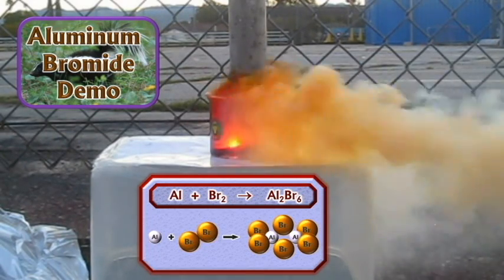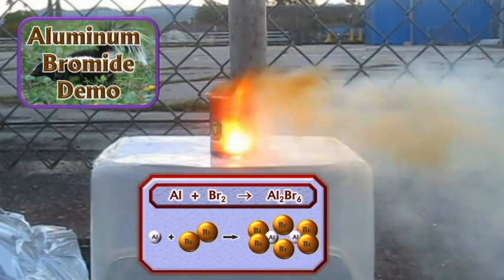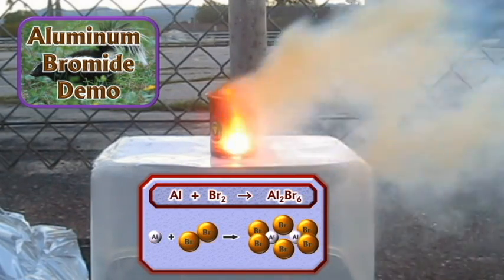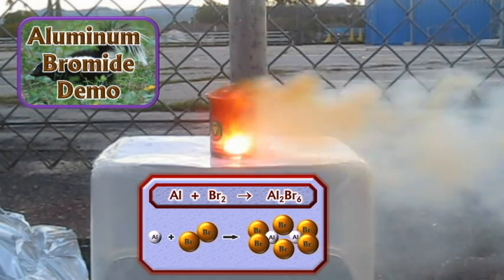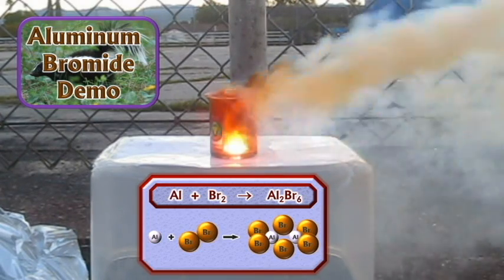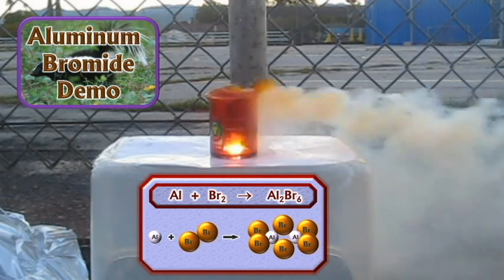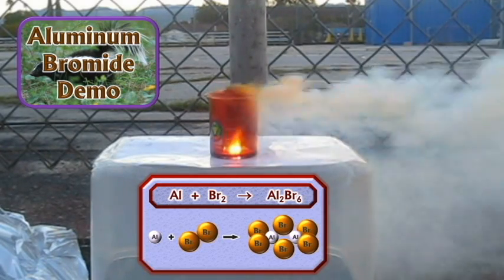Reaction. This aluminum bromide orange gas is billowing away. It's an intense reaction. It's great. Let's close this up a bit. Try to use up all the bromine because we don't want to put it back in the storeroom. And this is the end of this beaker. This is doom and destruction. This particular beaker will not be used again.